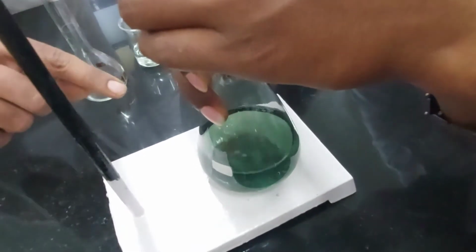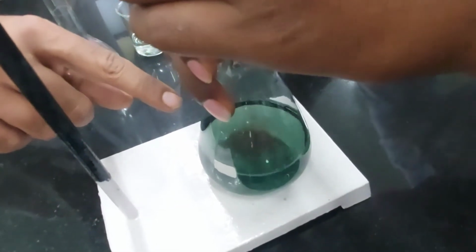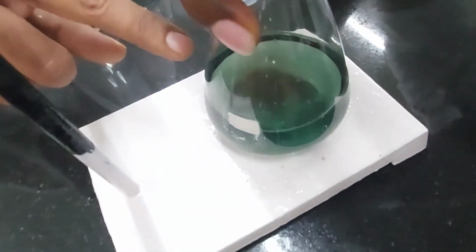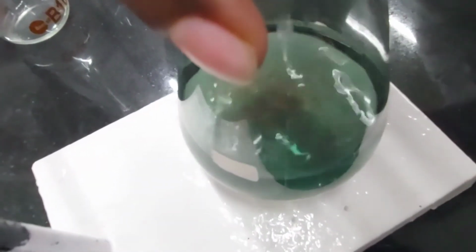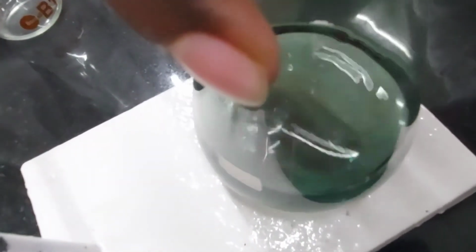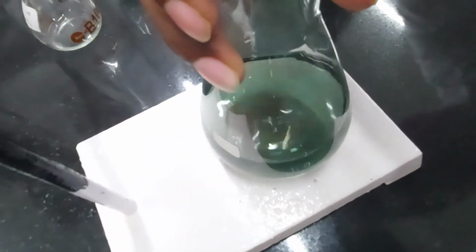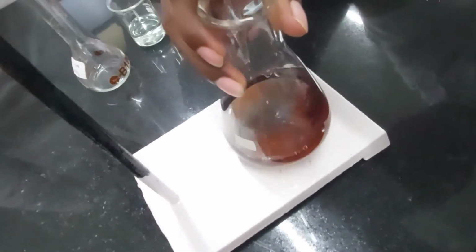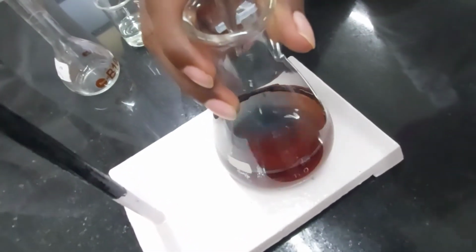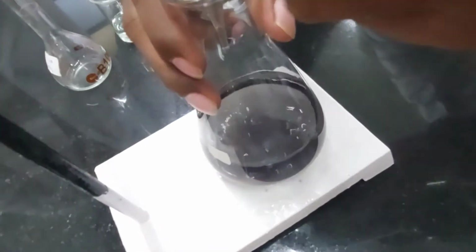Going on. Yeah. Now, wherever the drop is falling, you are able to see the formation of red color. Rupesh, if you could zoom in where the drops are falling. Can you see a reddish brown wherever the drop is falling? Now you go extremely slow. Yeah, there you go. Stop. That's the end point change. Yes, it is.